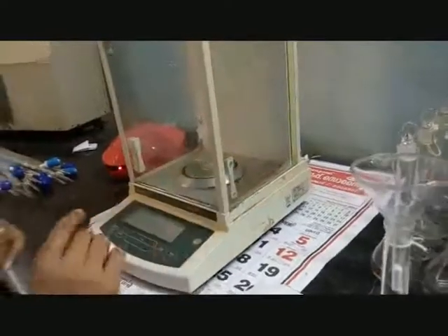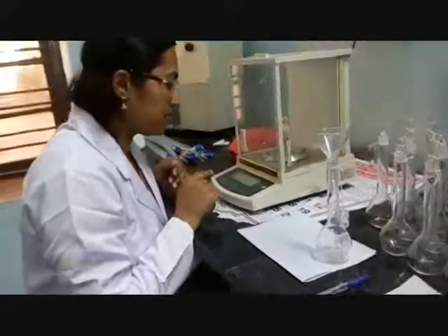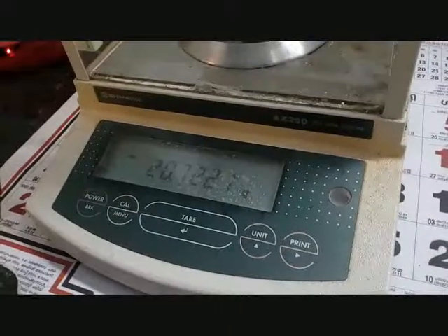Then I have to take the weight of the weighing bottle after transferring Na₂CO₃. That is, 20.7221 gram. Then from these two quantities, I will get the weight of Na₂CO₃ transferred to the standard flask. That is, 21.3148 minus 20.7221 gram, which equals 0.5927 gram transferred to the standard flask. Now from this weight, we can calculate the normality of Na₂CO₃.